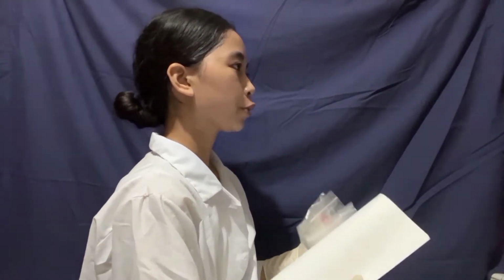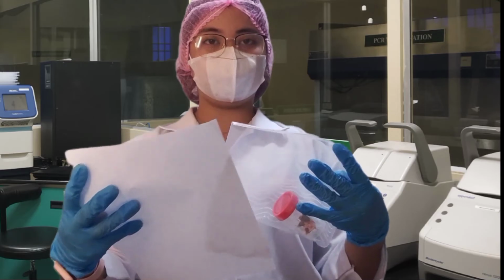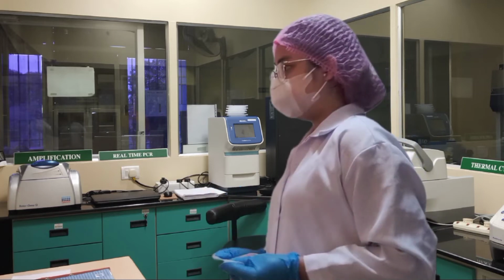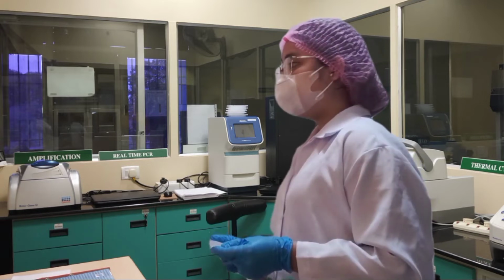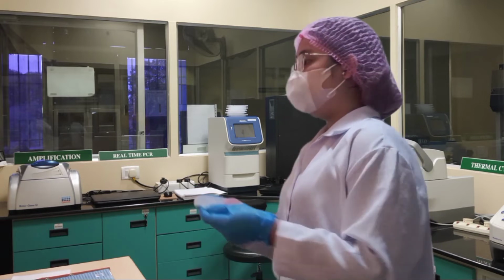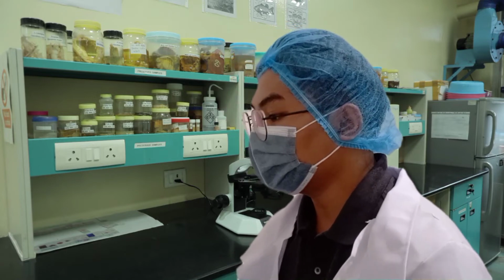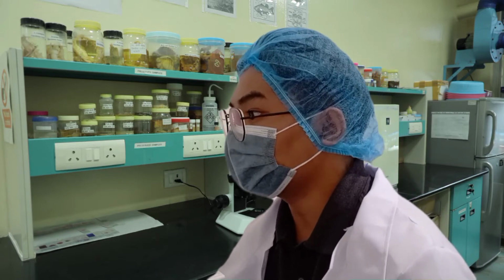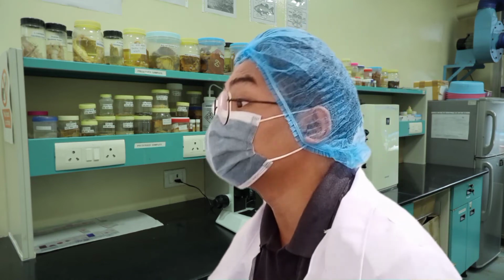Good morning, Ma'am Mendoza and Mr. Rodriguez. This is the tissue sample po for tissue biopsy along with the patient's requisition form. Before you go, Ms. Rupido, let me check your handed sample first. Looking first at the specimen, the samples are submitted all together in one single container. Specimen should be in an appropriate collection container, separated from one another. I also noticed here in the submitted requisition form, the name of the patient is spelled differently from the specimen container. Besides, the requisition form is incomplete as the hospital number is missing.